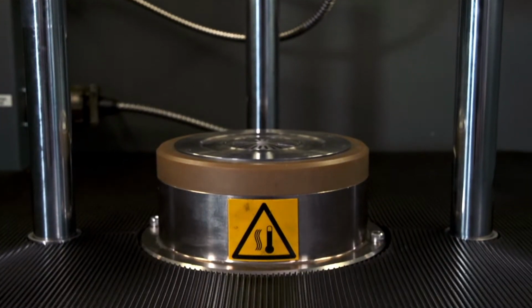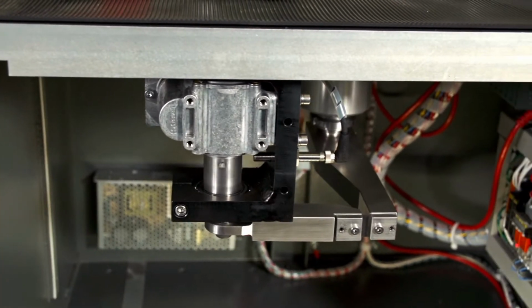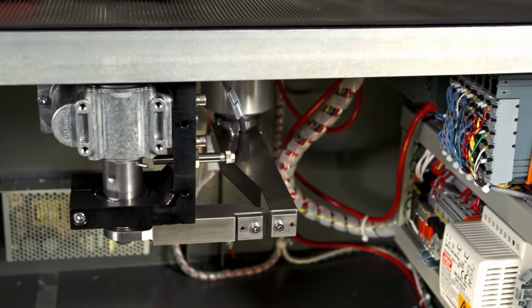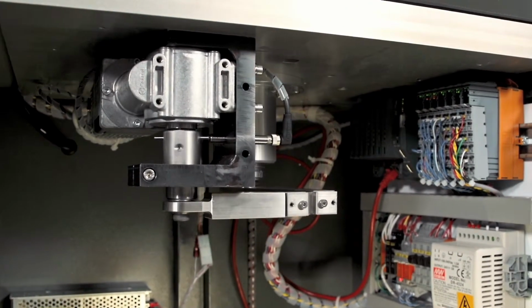A new MonTech motor and gearbox assembly is then installed. This includes a new rigid C-frame mounting, eccentric, bearing, and timing circuit. This assembly provides better test repeatability and greater accuracy.